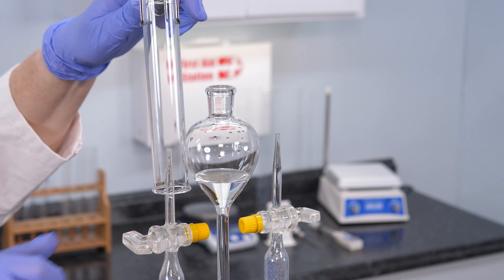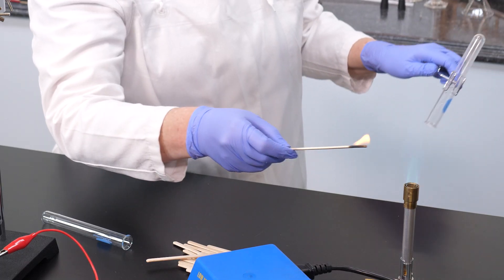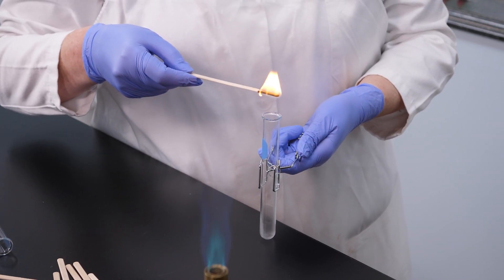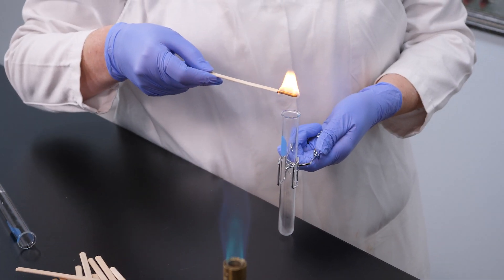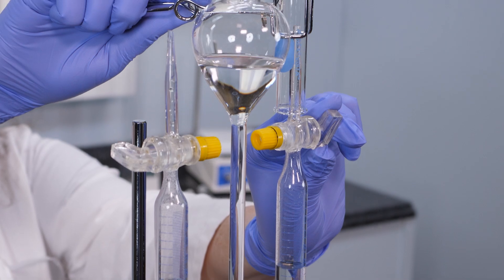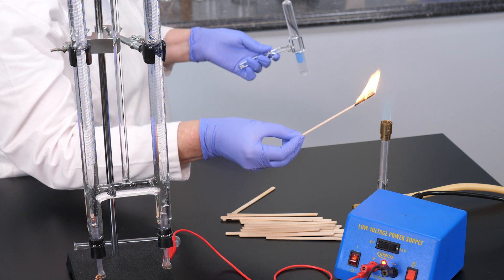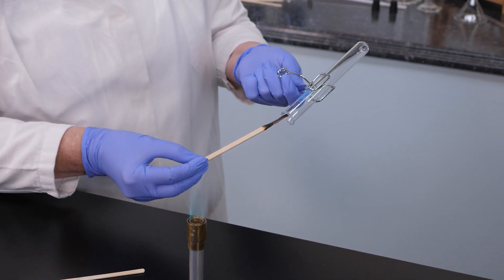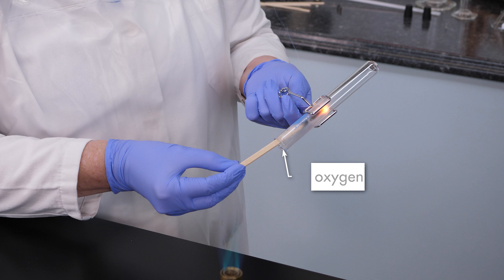We will collect a small amount of hydrogen gas in this test tube from the left collection tube. See what happens when we place this burning wood splint near the opening of the test tube. When the flame from the wood splint came near the tube, the hydrogen gas ignited and produced a loud pop, confirming we had hydrogen gas in the tube. We will collect a small amount of oxygen gas in this test tube from the right collection tube. After blowing out the flame on the wood splint, see what happens when we place the glowing wood splint into the test tube. The oxygen in the test tube reignited the flame on the glowing wood splint, confirming we have oxygen. By using electrolysis, we were able to decompose water into its component elements.